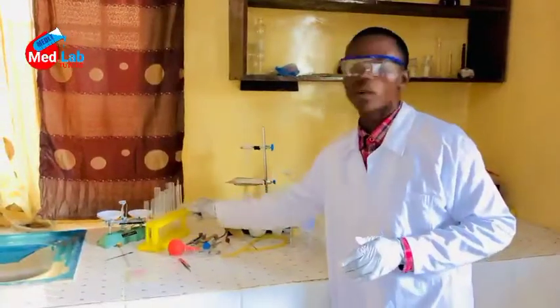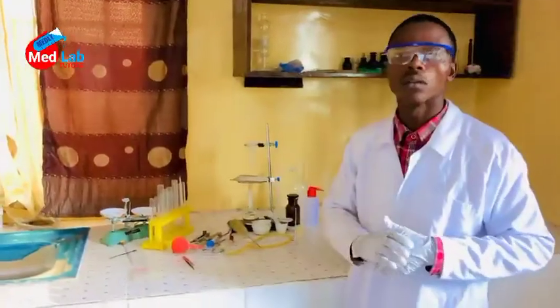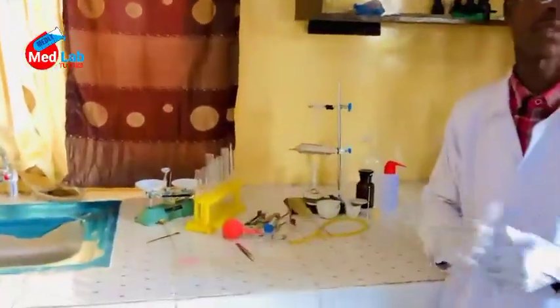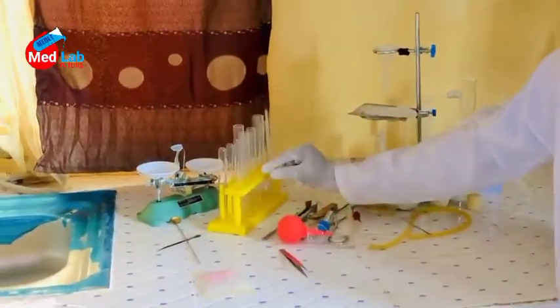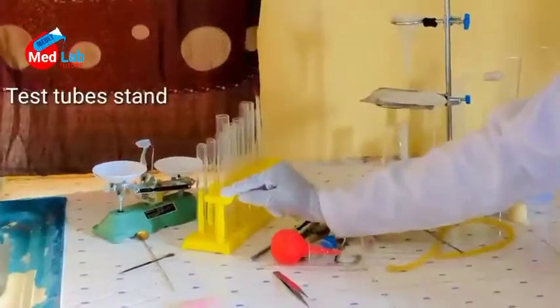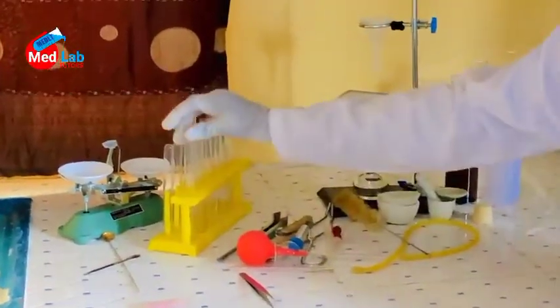This is the time that we take a look at our test tubes and the test tube stand. This, you see, with yellow color, is the stand. This is the test tube stand, and these are the test tubes. These tubes are what we use to perform tests.